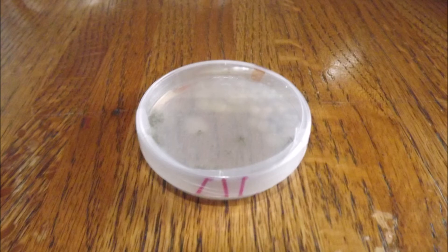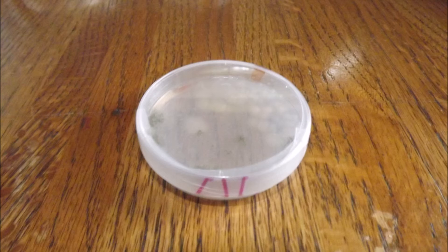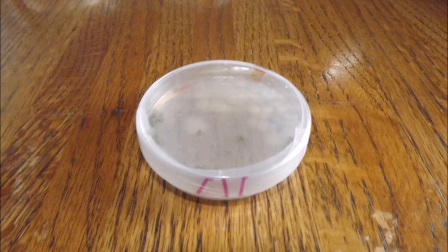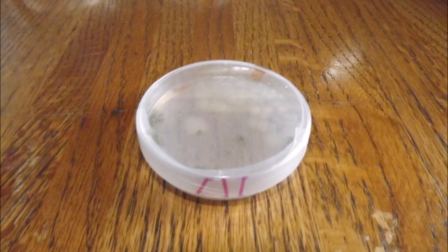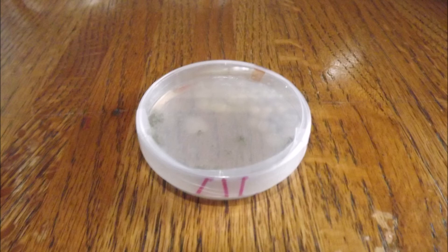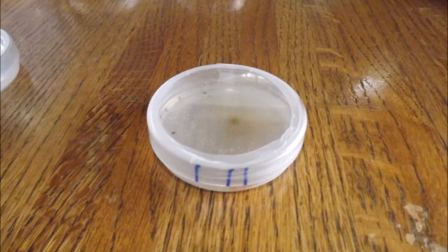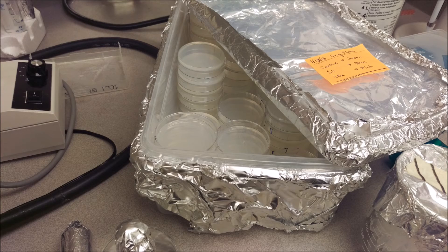So unfortunately, we gathered no viable data from this experiment. The contamination spread too quickly into too many plates to be able to accurately record how many worms were alive on each plate.